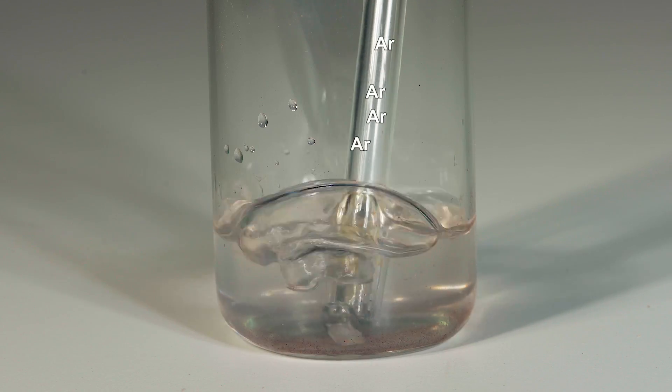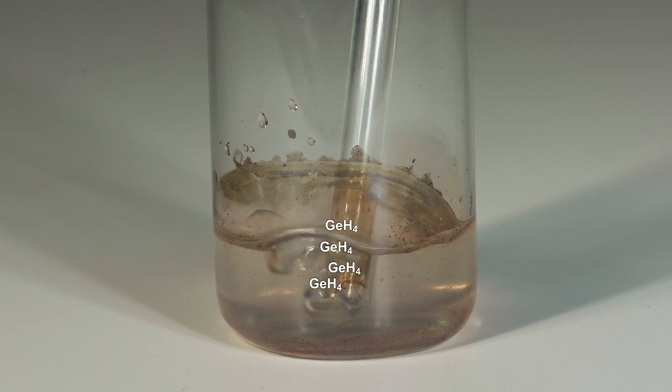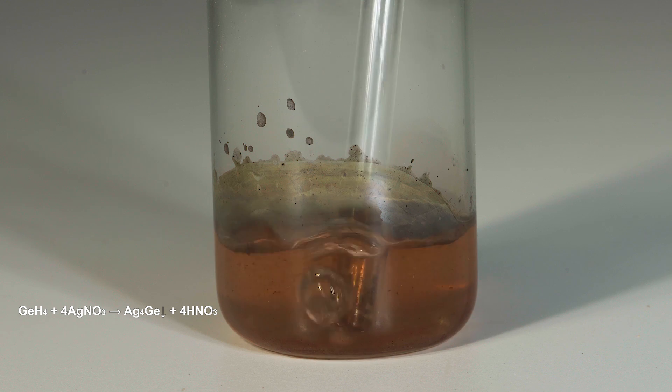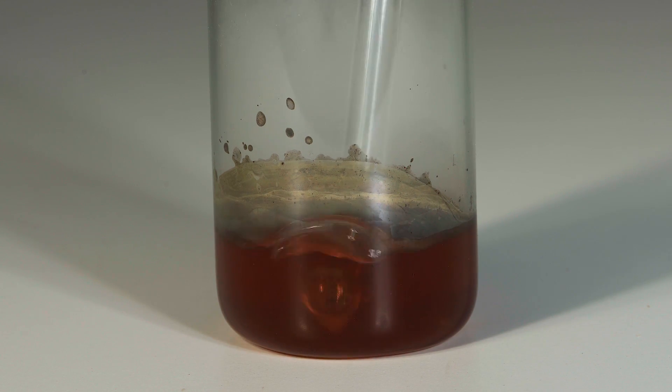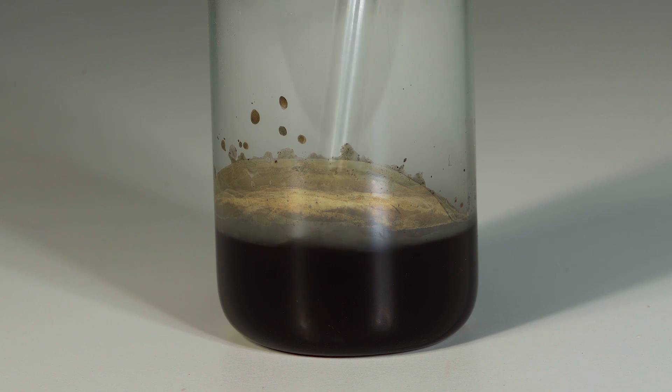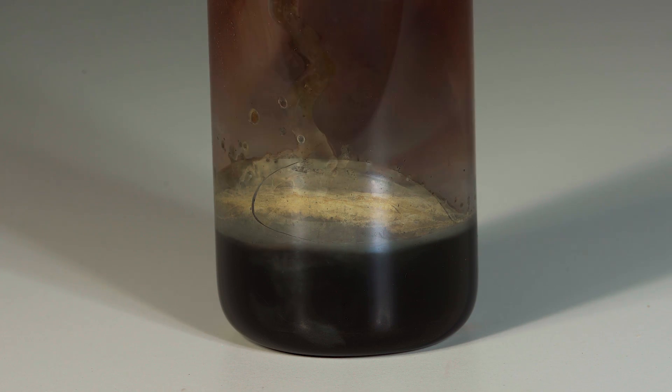The reaction with silver nitrate is a germane qualitative reaction, as it results in the formation of a dark non-water-soluble chemical, that is silver germanide.